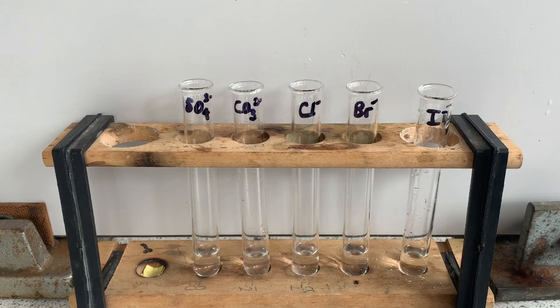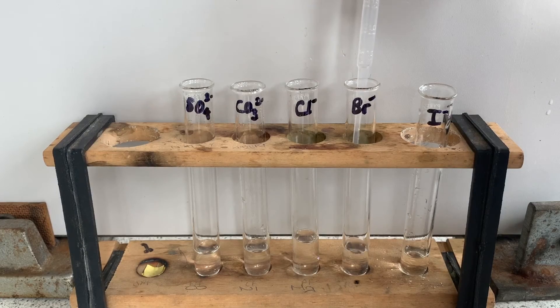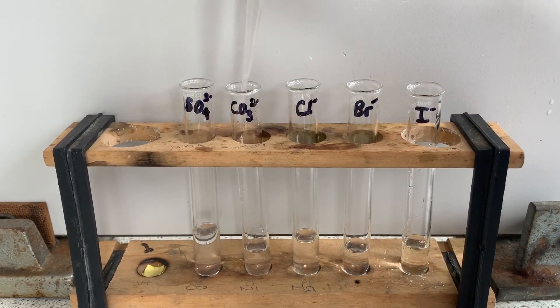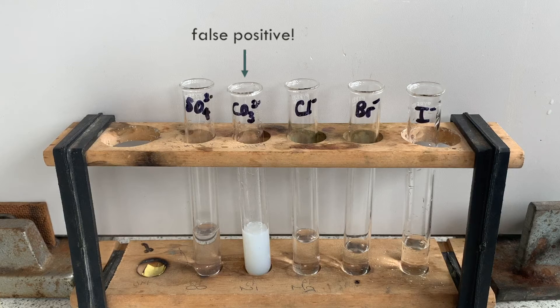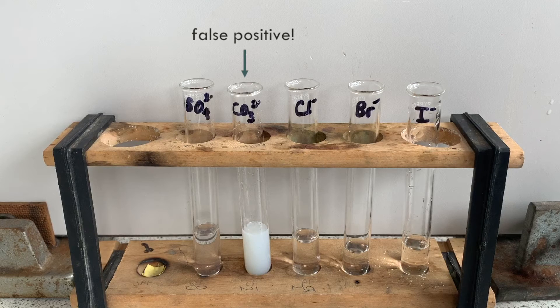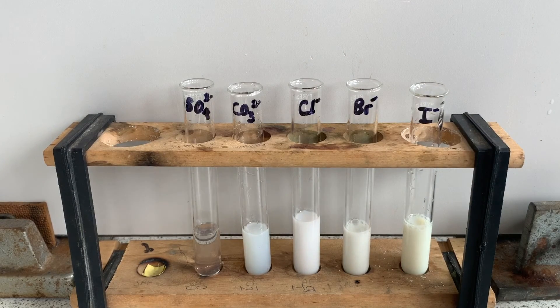Here are each of my solutions in the relevant test tube and I'm going to start off by adding some nitric acid to each. This should get rid of any carbonate ions but as you'll soon see I don't think I added enough here. Now I'm adding silver nitrate to each test tube. You can see a white precipitate has formed here which means there must be some carbonate ions still there giving us a false positive — they've reacted with the silver nitrate to form the white silver carbonate. If I had added more nitric acid to begin with the carbonate ions would be fully removed and the solution would remain colourless when silver nitrate is added. As you can see the reaction with chloride ions forms a white precipitate, the reaction with bromide ions forms a slightly darker cream precipitate, and the reaction with iodide ions forms a yellow precipitate.